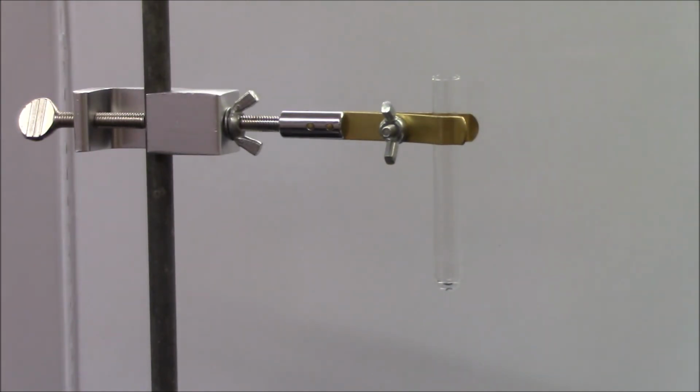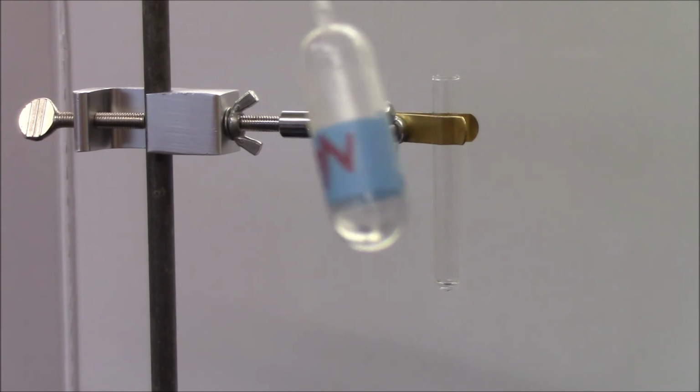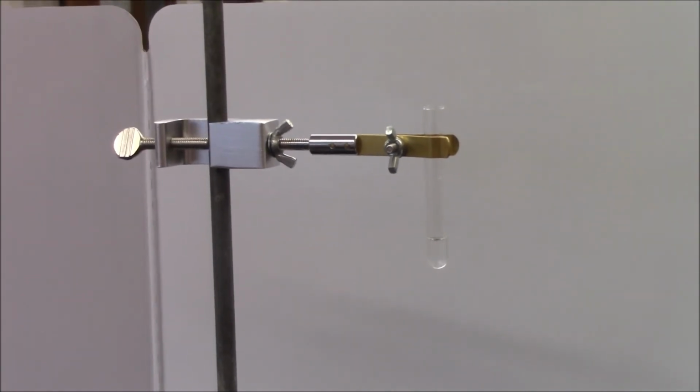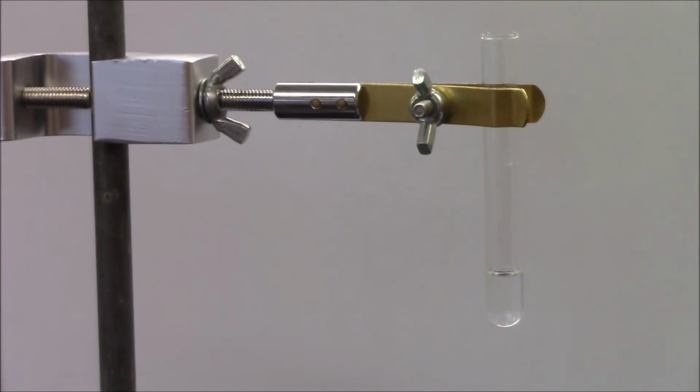In my next reaction, I'm going to mix hydrochloric acid and sodium bicarbonate. Here this is. Hold on for one moment. If you look, my sodium bicarbonate is clear and transparent. Okay. And as we've already observed, my acid is also clear and transparent. Now I was going to try to maybe zoom in a little more here, but if I go too much then you won't see anything.